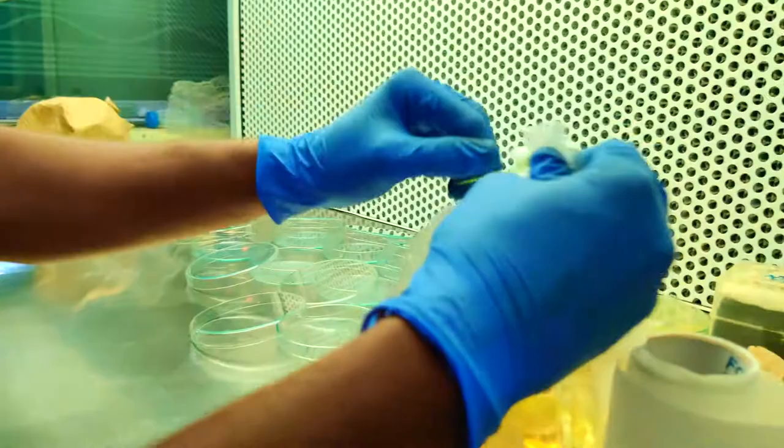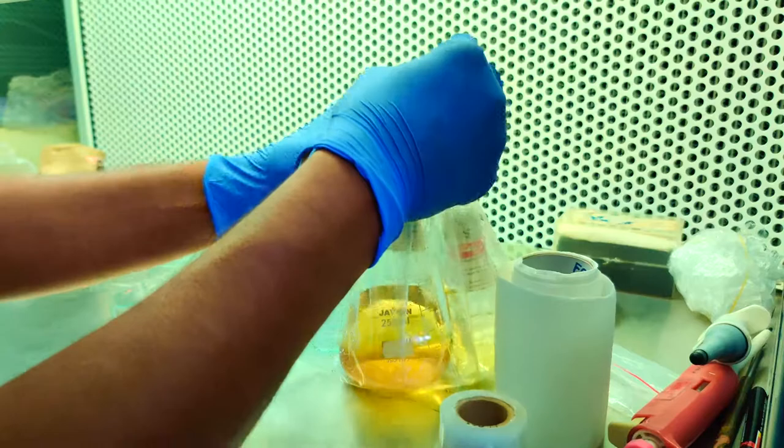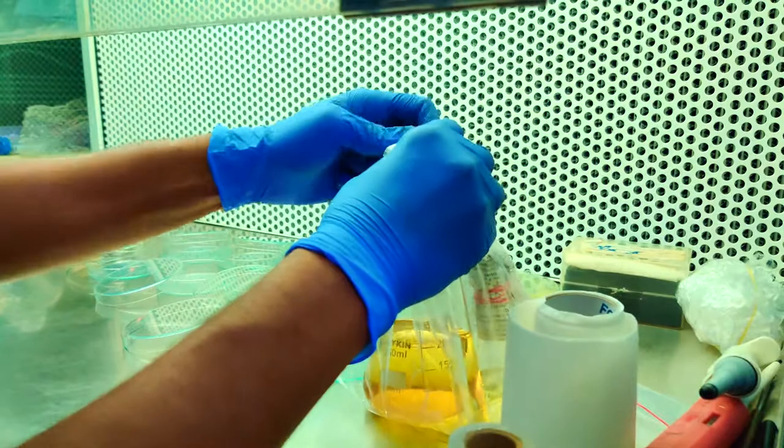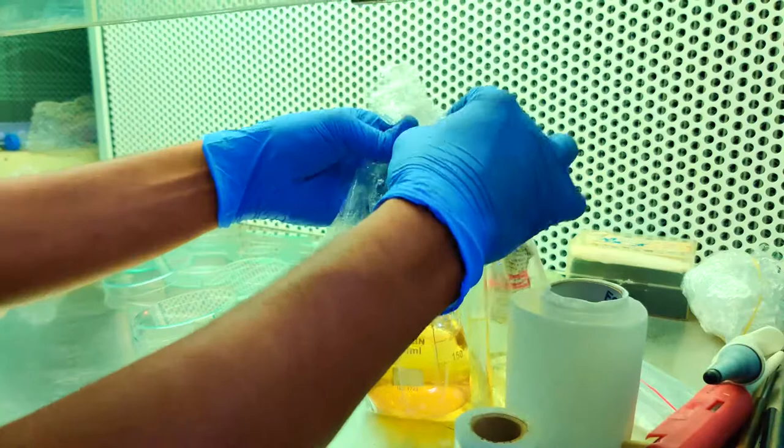Before pouring, we wrapped it to prevent any water vapor from entering in, and properly rubber banded it and taped it so that nothing will be entered.